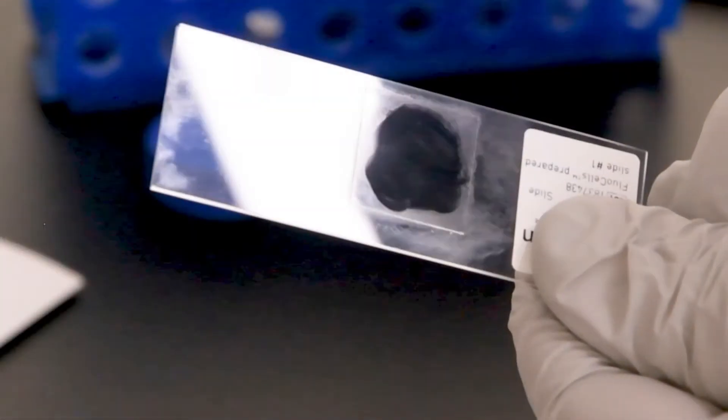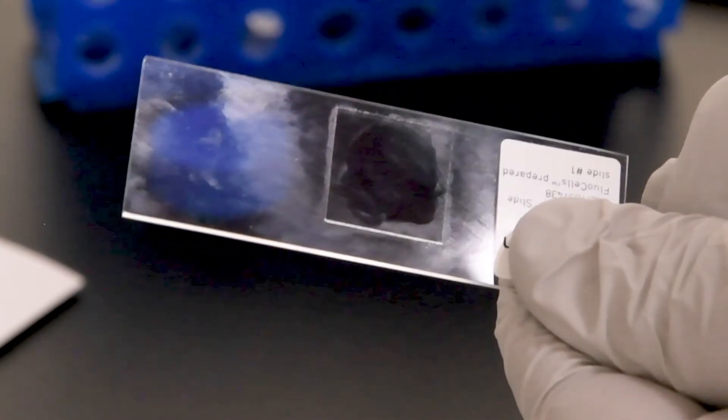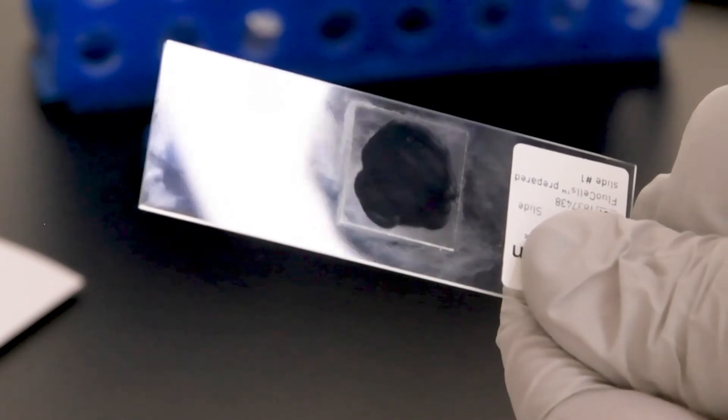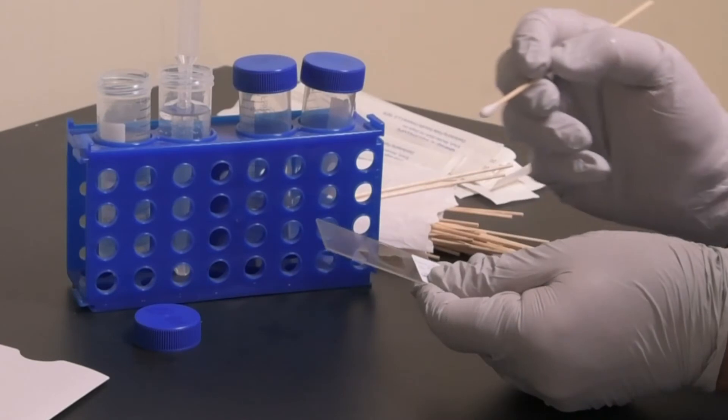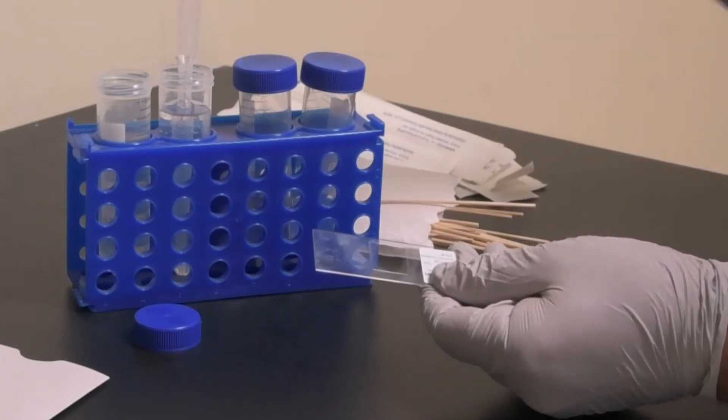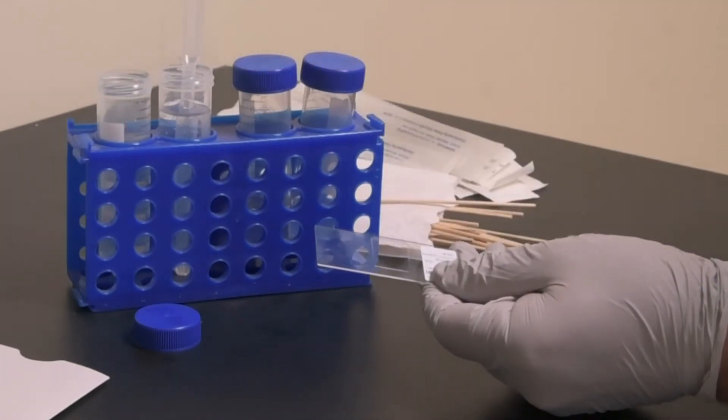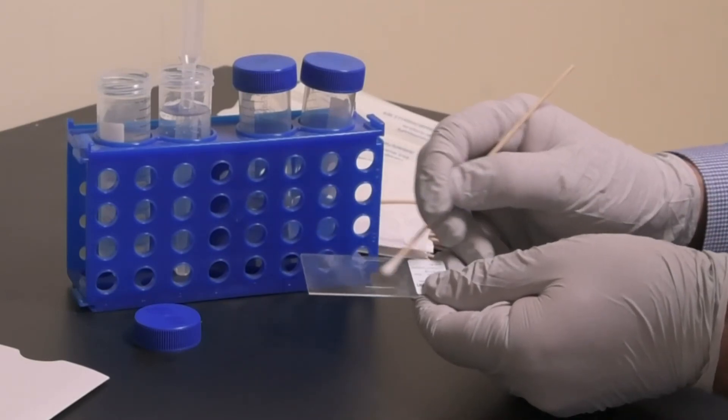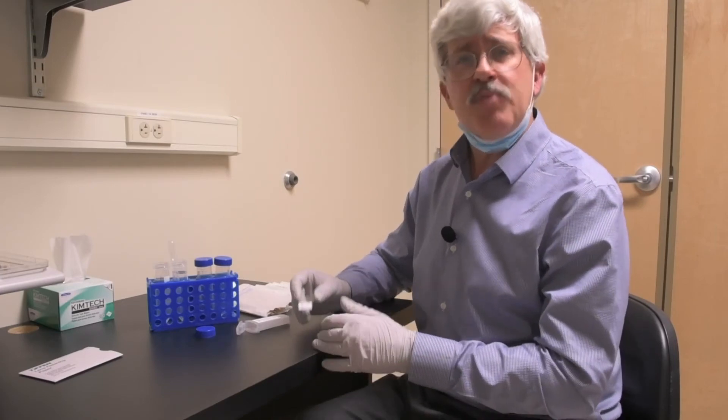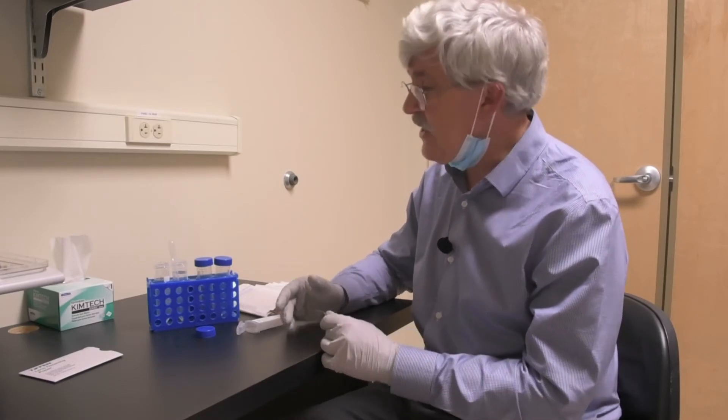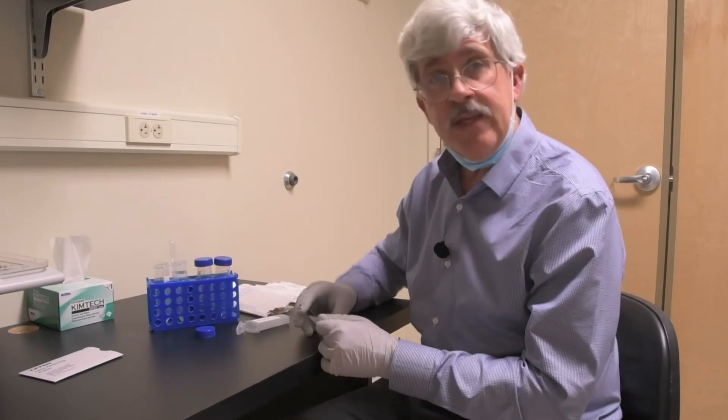Tilt it toward the room light. If it looks hazy, use a fresh swab to do it again. Do not reuse the swabs, because you'll just wind up smearing whatever oil it collected back onto the slide again. Try to avoid getting close to the edges of the coverslip, as you can wick ethanol underneath or draw out the mounting media and smear that around. So if you grew cells on coverslips, and then stained and mounted them for confocal, you may find there's a haze on there that doesn't come off with the ethanol. That's because it's probably crystallized salts from the PBS from when you grew your cells. Ethanol doesn't touch that. So we have some DI water over here to the side that you can use instead.